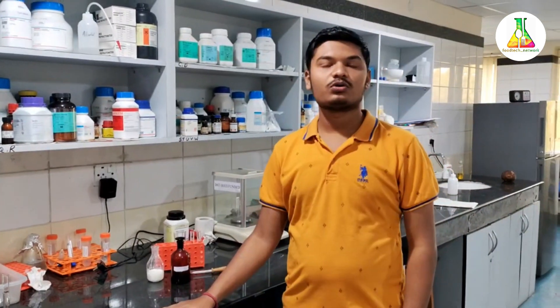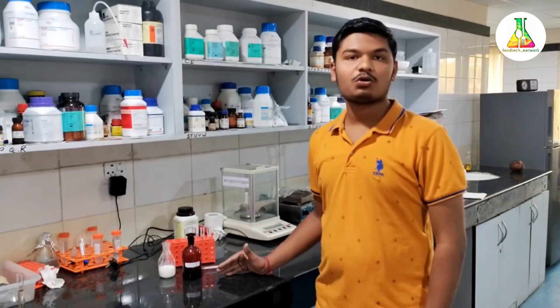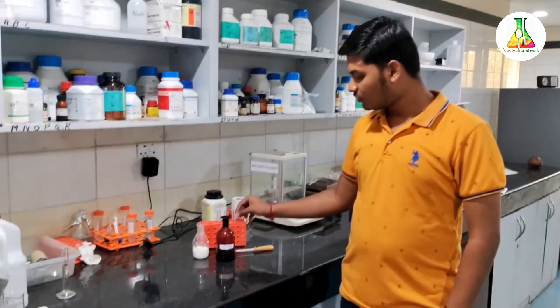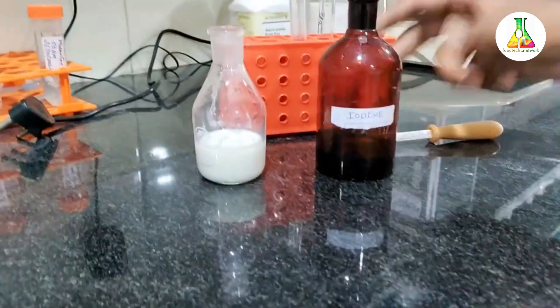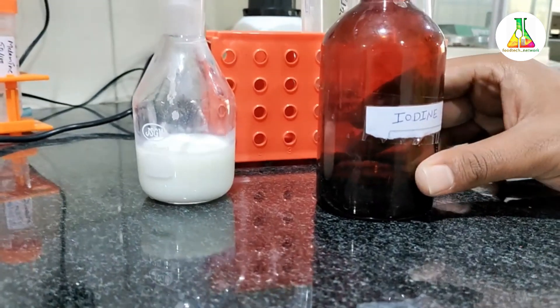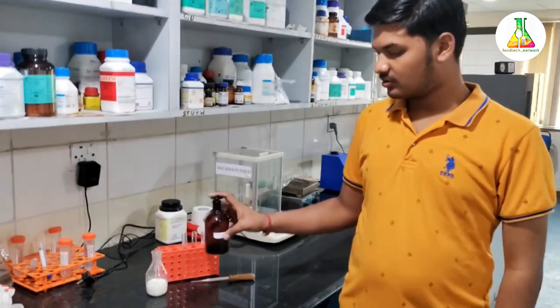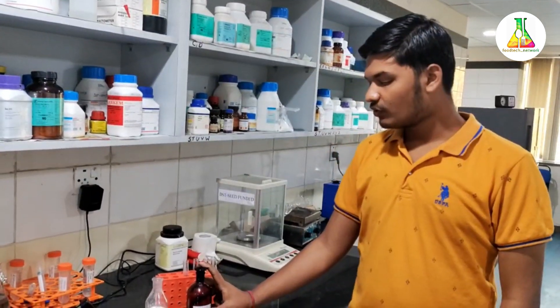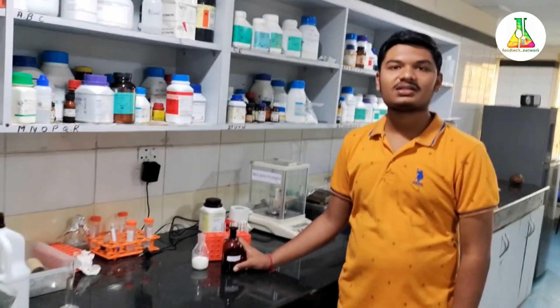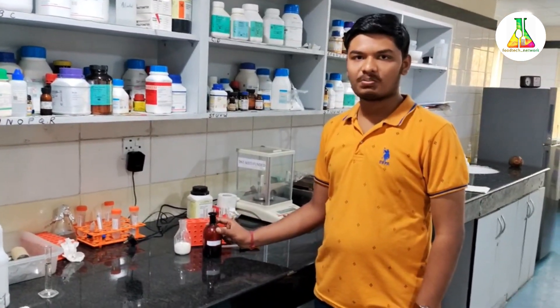Today we are going to perform the test for determination of starch in our milk sample. First of all, we need some milk samples to test. The reagent for the starch test is iodine solution, which we prepare by dissolving iodine crystals in potassium iodide solution and mixing well. This KI solution is used for testing the presence of starch — as I've already mentioned, if starch is present in milk, it will form a complex with this solution and a deep blue color will be obtained.